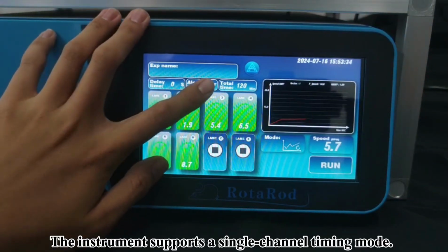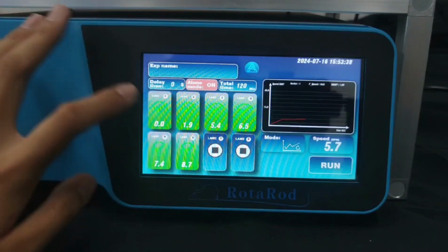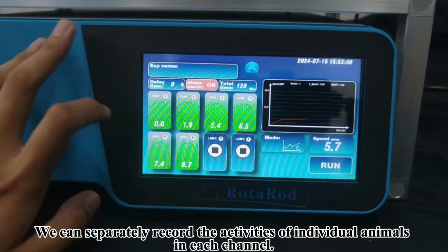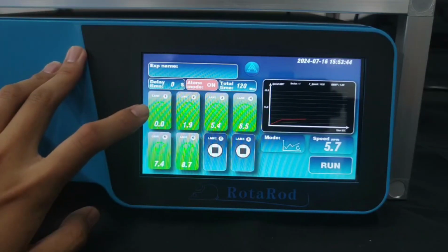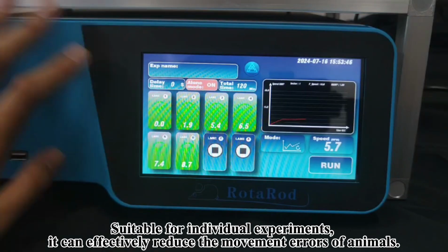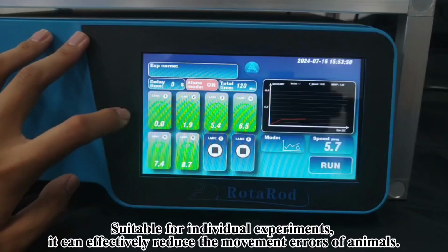The instrument supports a single-channel timing mode. We can separately record the activities of individual animals in each channel. Suitable for individual experiments, it can effectively reduce the movement errors of animals.